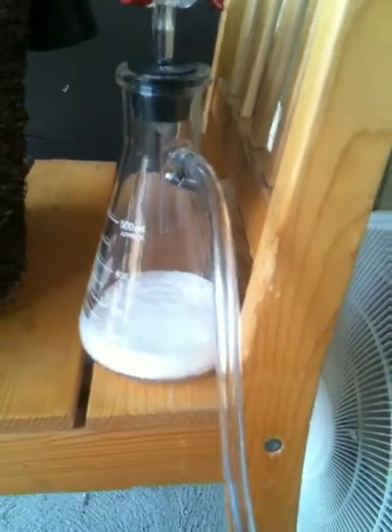Looks like it's working out. It's coming in from here — this is the generator. It's just table salt and sulfuric acid. It gives off a reaction and produces a bunch of bubbles through a little stir.